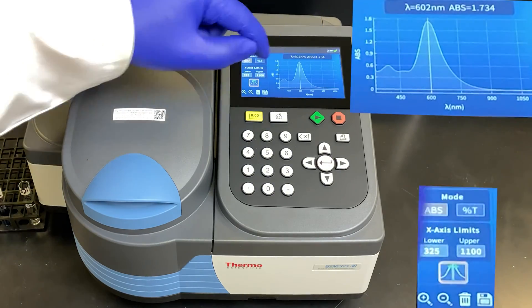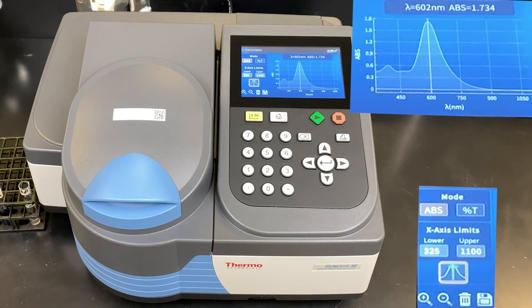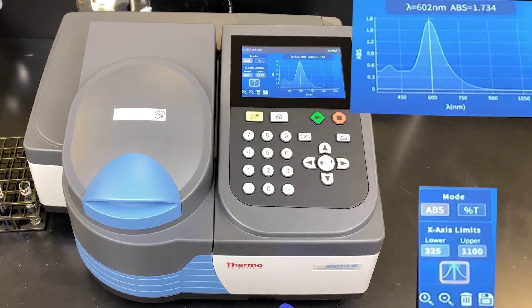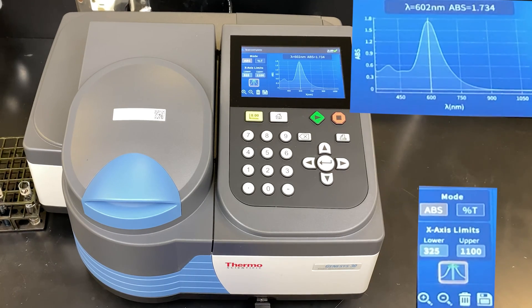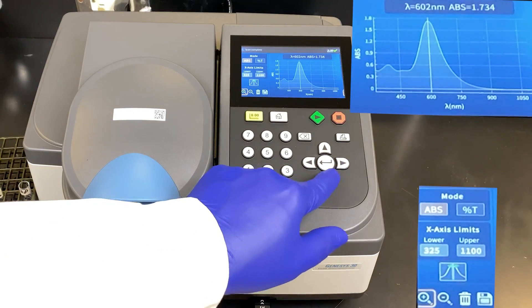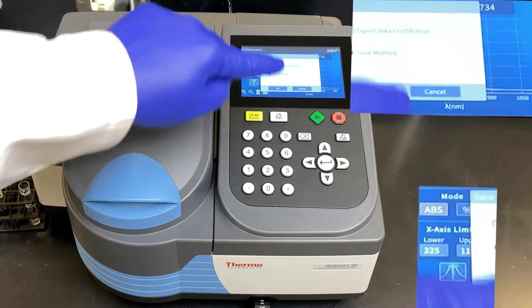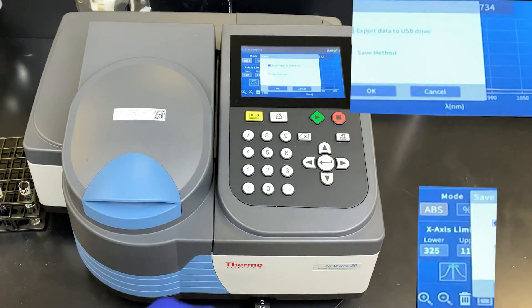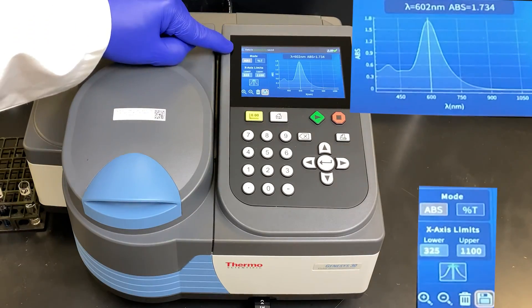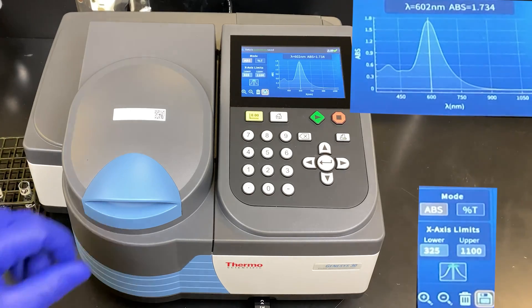Now we can save this data on a USB stick. Select the save feature, grab a USB stick — there's a USB port right here in the front. Plug it in, cursor down to the save icon, press enter, and select 'Export data to USB drive.' Select OK, and it has been transferred over. Disconnect the USB stick and open it in Excel to edit.